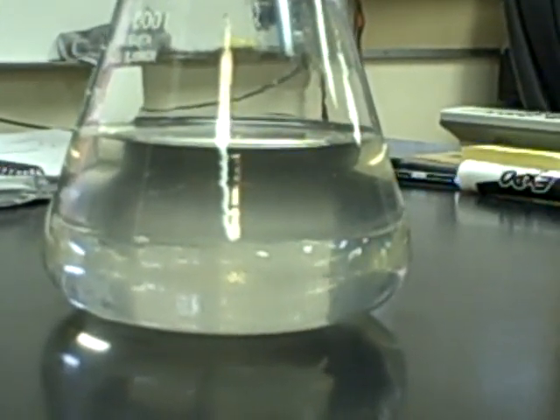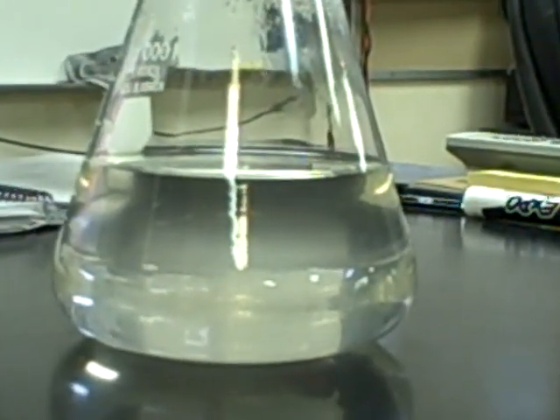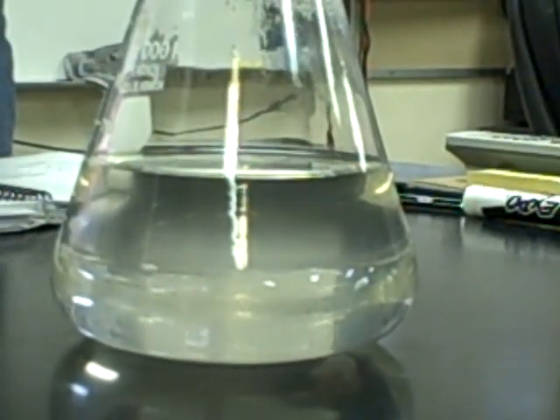Let me show you. Just a couple crystals. And if you zoom in, you might be able to see that sort of suspended in the middle of the solution there.